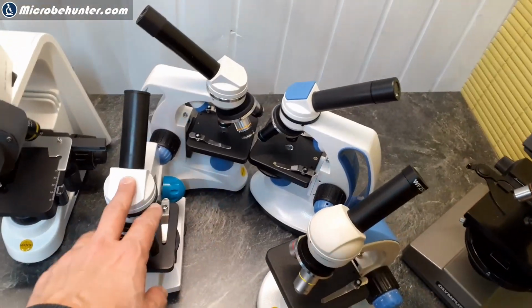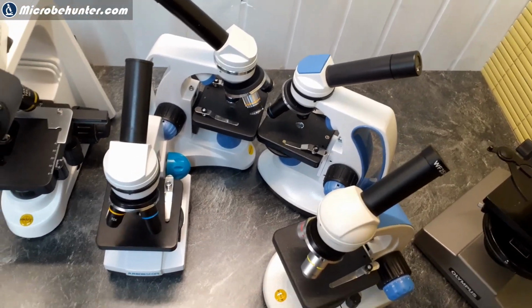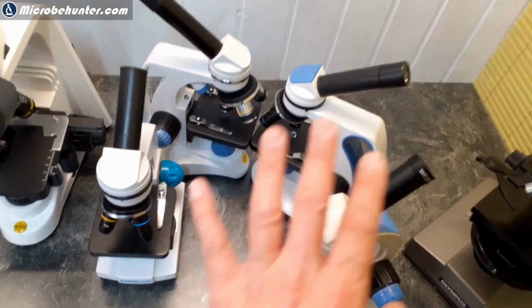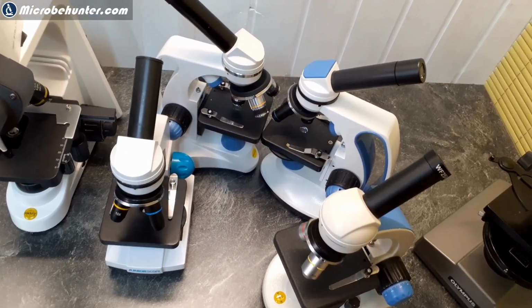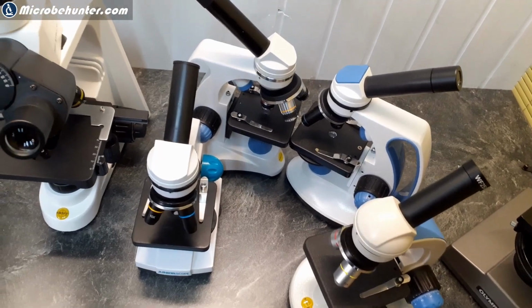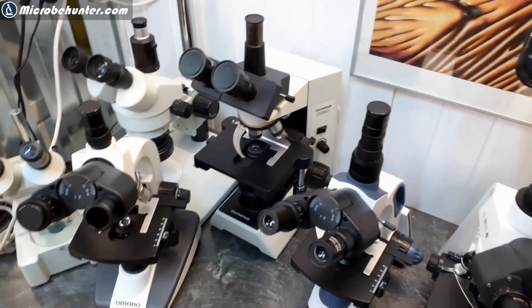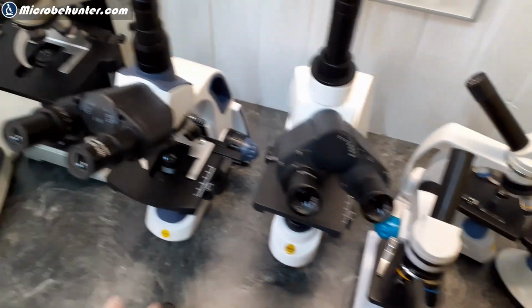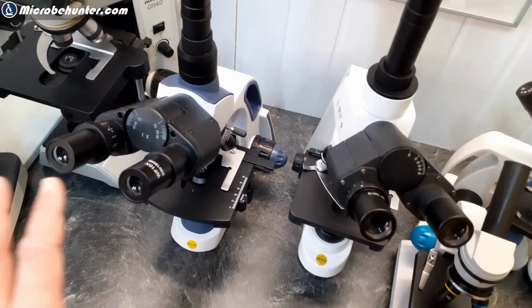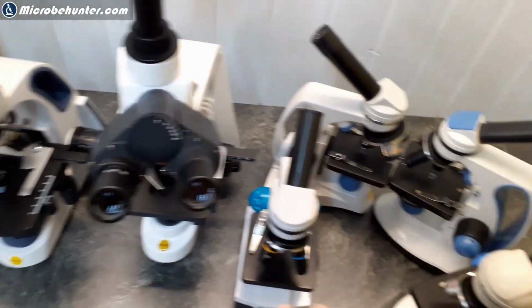But if you have an initial curiosity and you have some money to spare, around $80 to $100 or euros, then by all means start with one of those microscopes, and then you're going to see if you like it or not, and this satisfies your initial curiosity. And then later on, you can always think about different microscopes, because they are significantly more expensive, right? So the initial investment really doesn't make a huge difference.